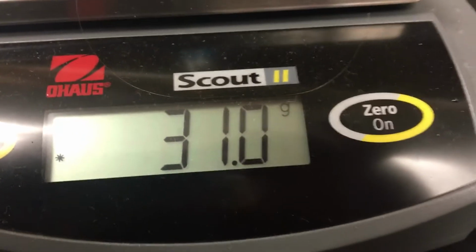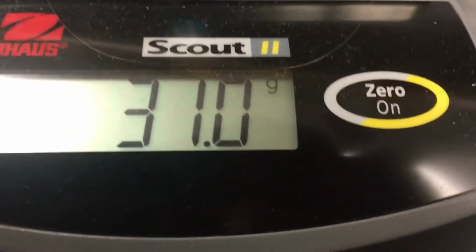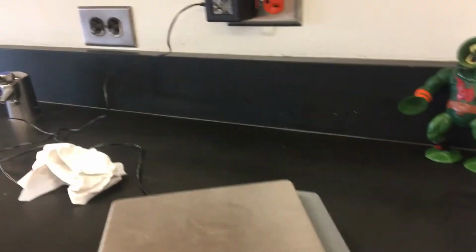Now we've got that as a mass. You know what, maybe we're gonna come back to this guy in a minute. Look at all those bubbles. It's not really gonna give us an accurate reading. Pump the brakes on that one, press pause, we're coming back later. All right, 4.